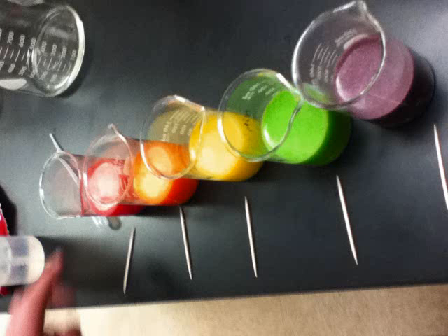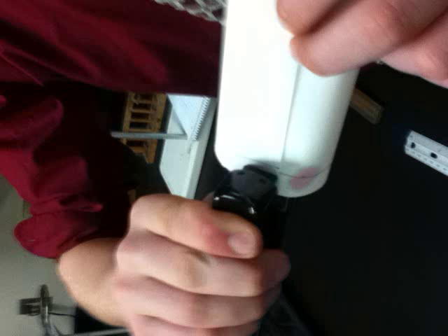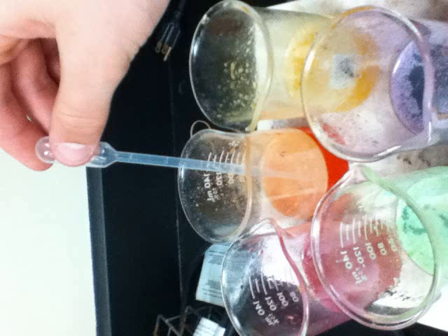The procedure is as follows. First, you dissolve each color of the Skittle in water. Second, you prepare the chromatography paper and the beakers. You cut the paper in half, draw a line across the paper 9 centimeters from the top, add 6 dots on each line 2 centimeters apart, put aluminum foil over the beakers, rubber band the foil onto the beakers, then remove the paper and use a ruler to see how far up they go and calculate their RF values.